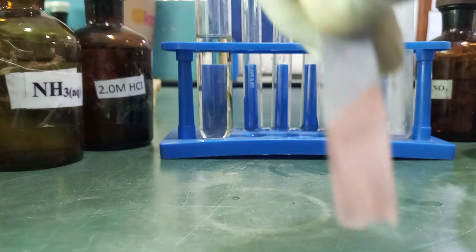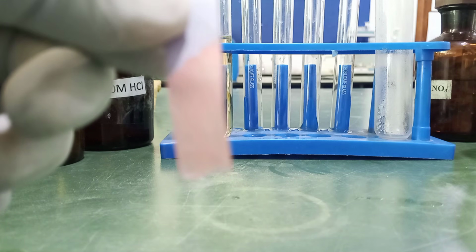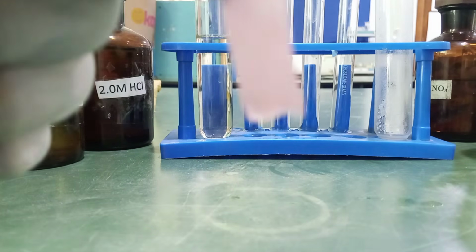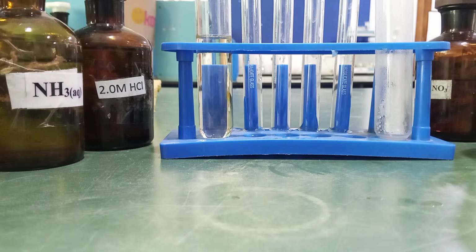The filtrate turns blue litmus paper red, which means that the filtrate is an acidic solution, which is correct because this filtrate is a solution of lead(II) nitrate, which is a product of a weak base, that's lead(II) hydroxide, and a strong acid, nitric acid. So which is why it undergoes hydrolysis to form an acidic solution.